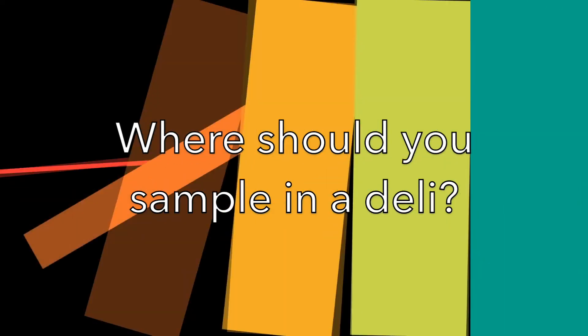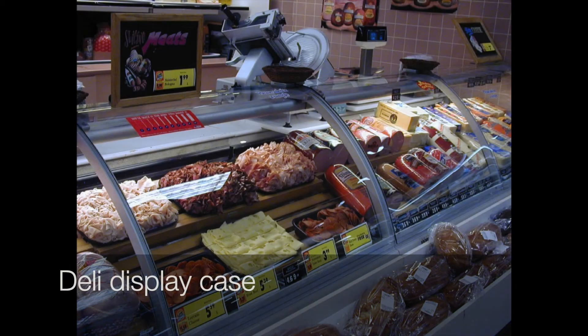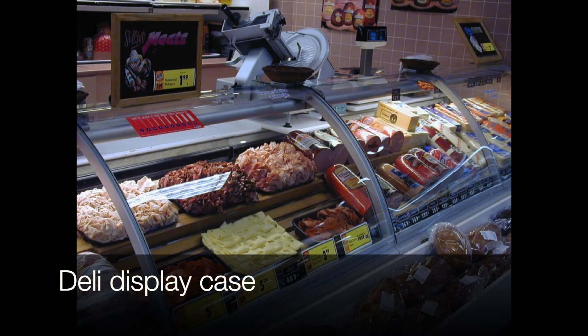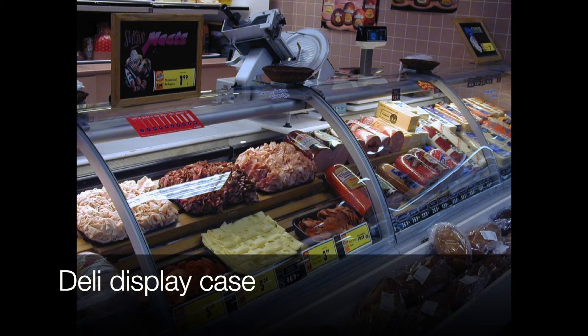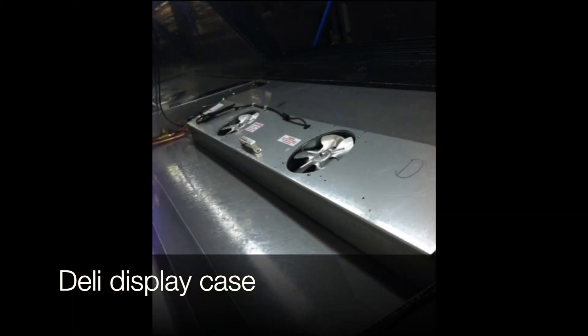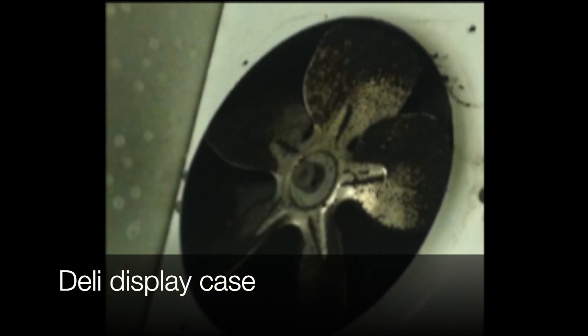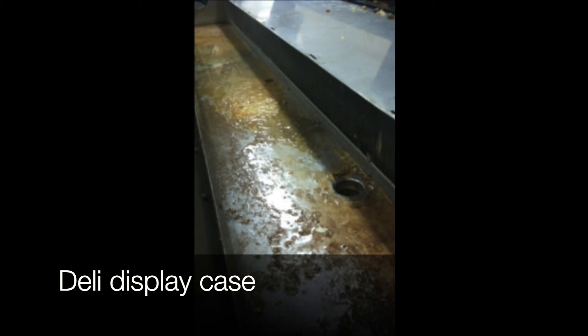Where should you sample in a deli? Here are some suggestions. Deli display case: Take a close look at deli display cases because they are rarely disassembled completely. You may need to disassemble these to sample them — ask facility personnel to help you. Ideally, ask for disassembly down to the coils and sample while the deli case is being disassembled. Check out cooling fans and drains in the deli case too.